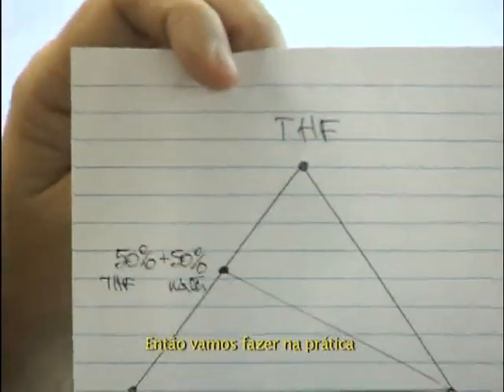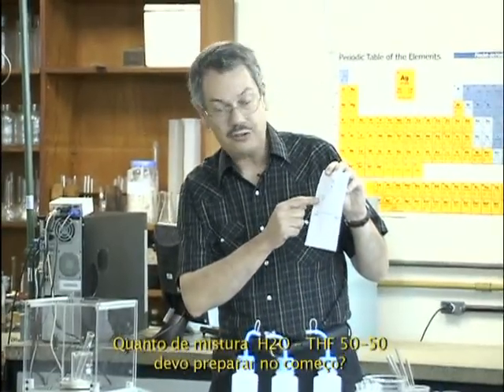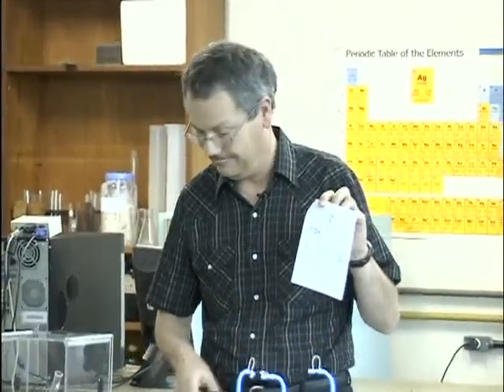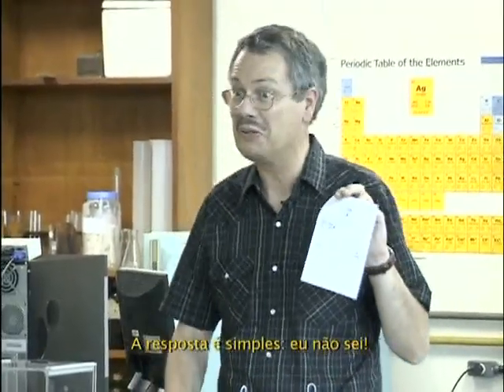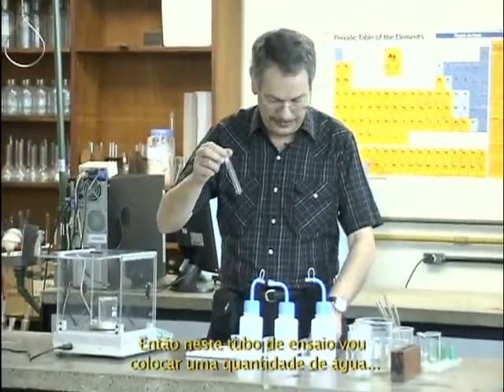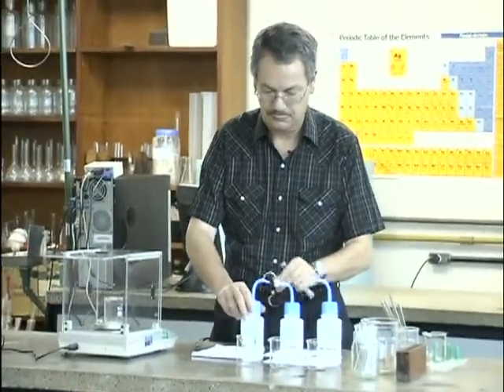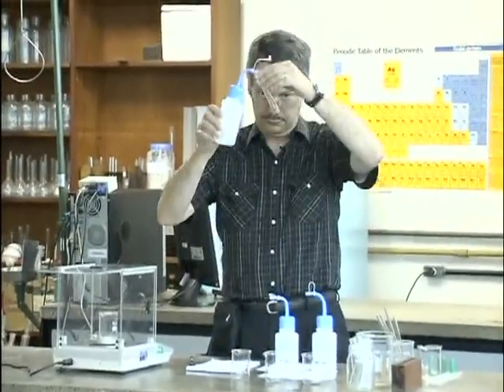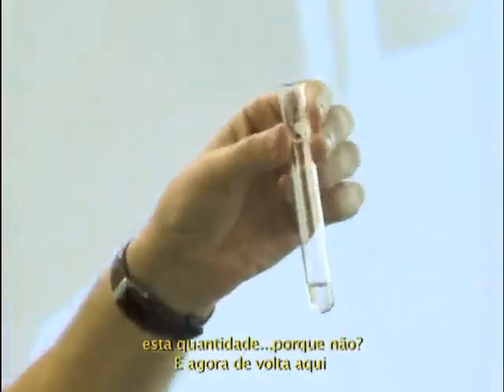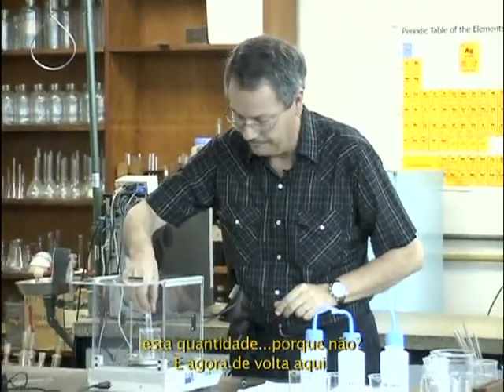Okay, so let's do it practically. How much water-THF mixture 50-50 should I prepare at the beginning? The answer is simple, I don't know. Good. So in this test tube, I will put a certain amount of water. This amount. Why not? Okay, and now I put this back in here.